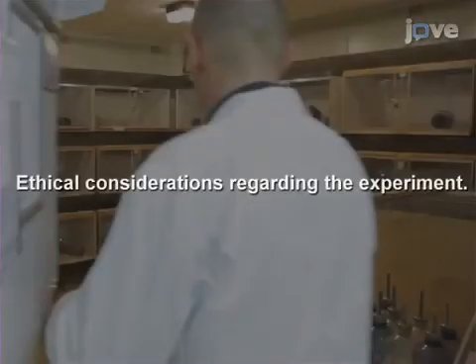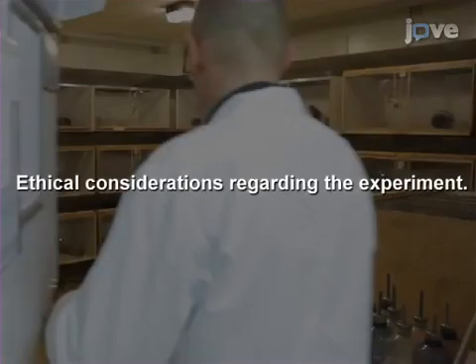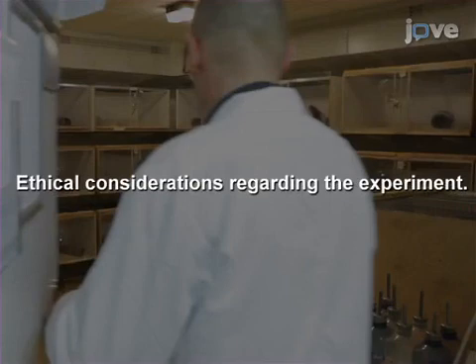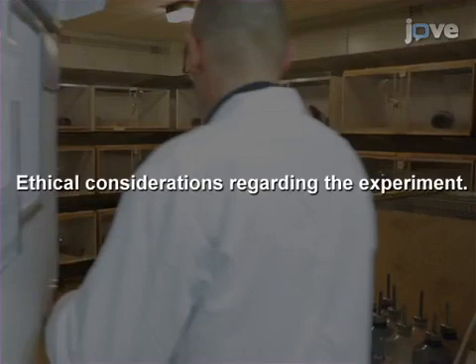Please notice that the resident intruder paradigm is not free from ethical concerns. Serious suffering may occur in the intruder male. Potential animal suffering should always be in balance with the main scientific aims of the experiment.